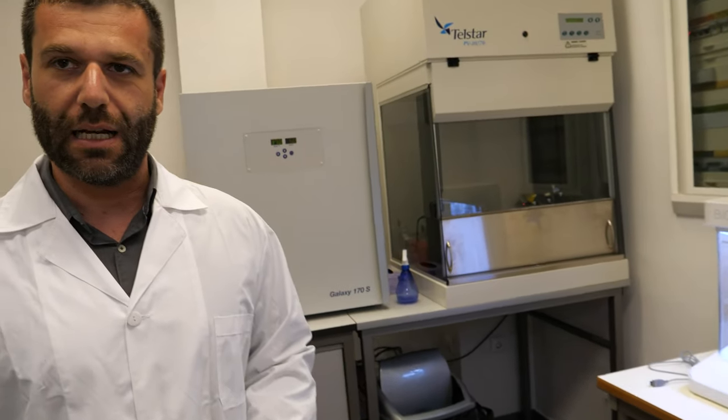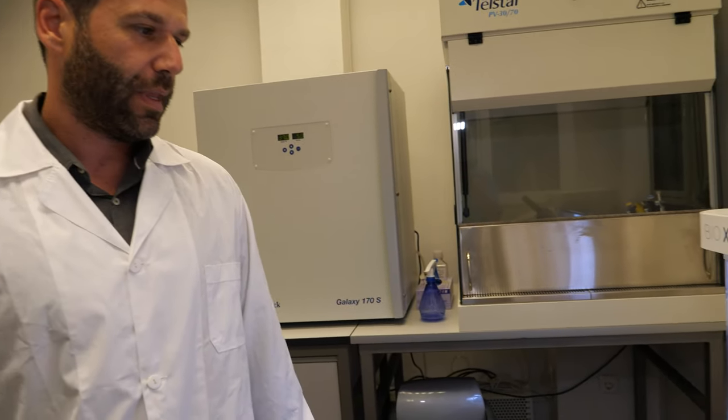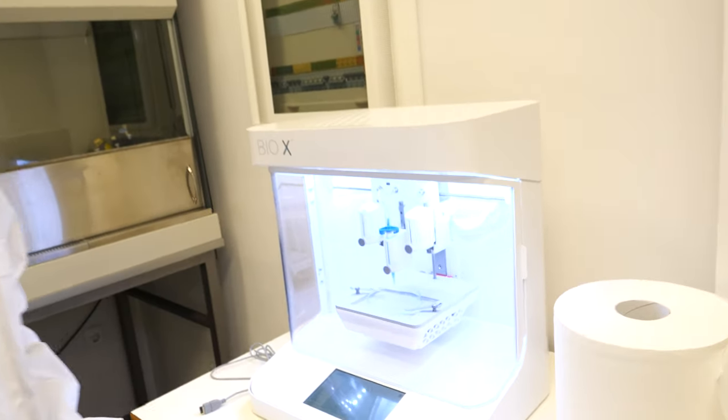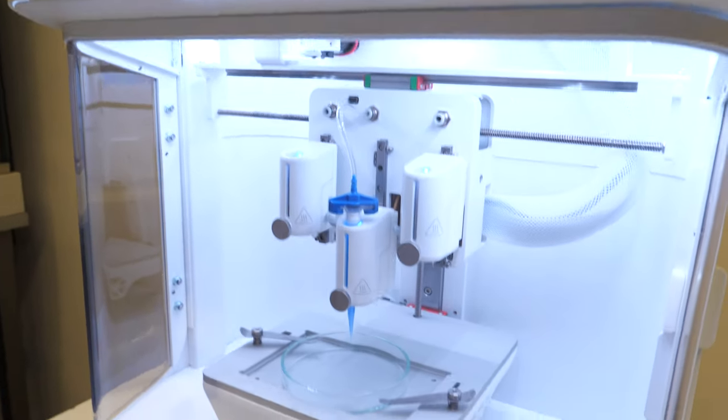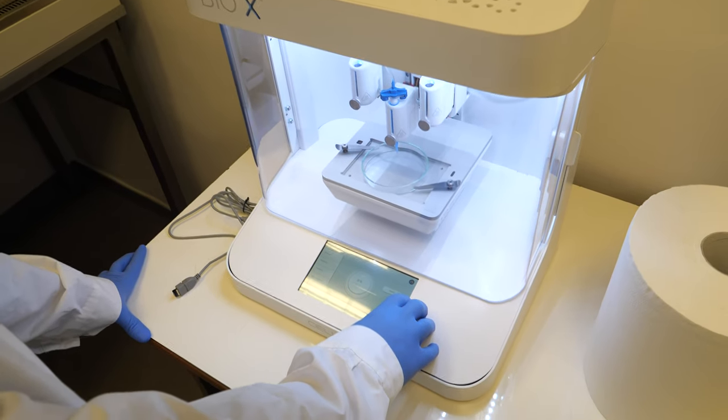This is our cell culture room. We also have a bioprinter. We saw how we produce scaffolds and drug delivery systems at the nanoscale — nanoparticles and nanofibers. They can also be used as part of a 3D complex construct that mimics native tissues. To build this structure we use a 3D printer called a bioprinter. This is the BioX — our 3D bioprinter — currently set up to bioprint a model of a nose.